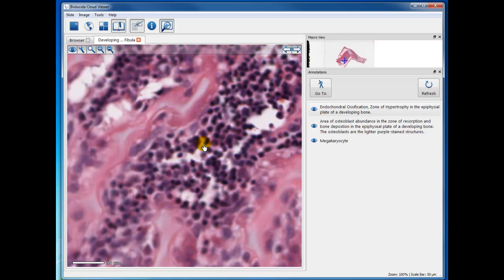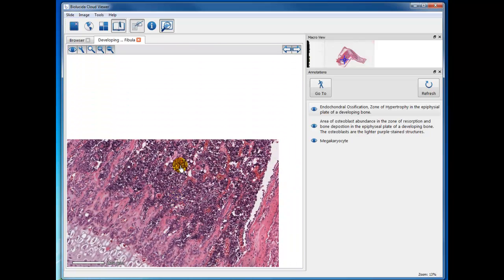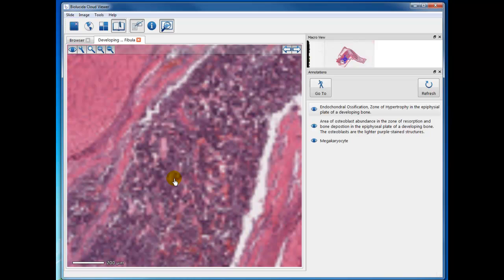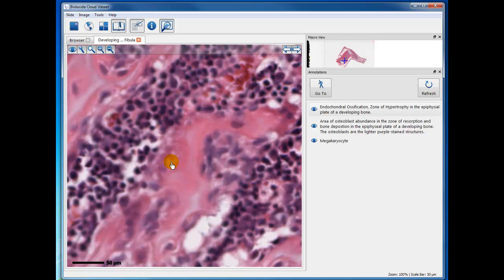And the sharpness of this image is lacking when you actually fully magnify it, but that will probably depend on where you look. Down here it may be a little bit more sharp, and that's because perhaps the specimen lifted up here off of the glass slide, so it's not as sharp.